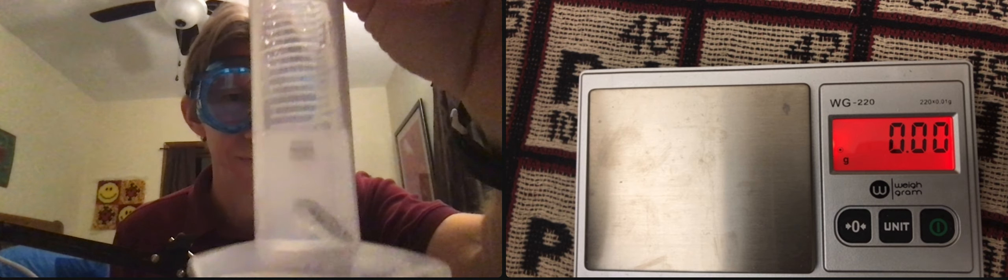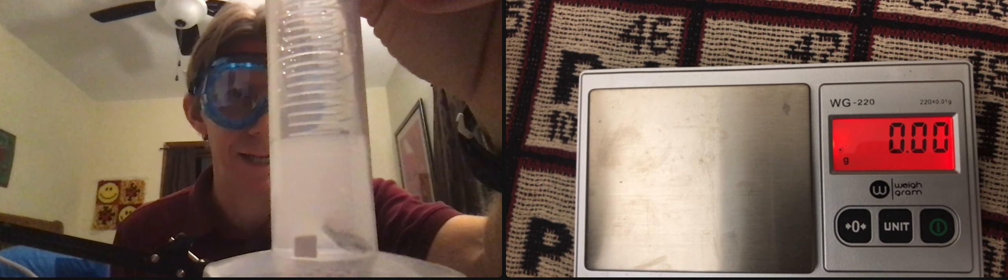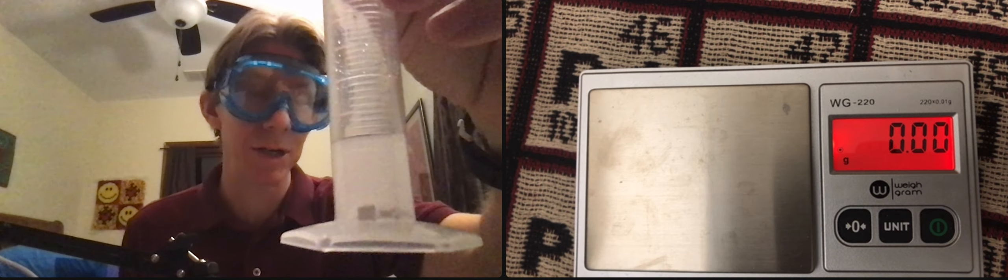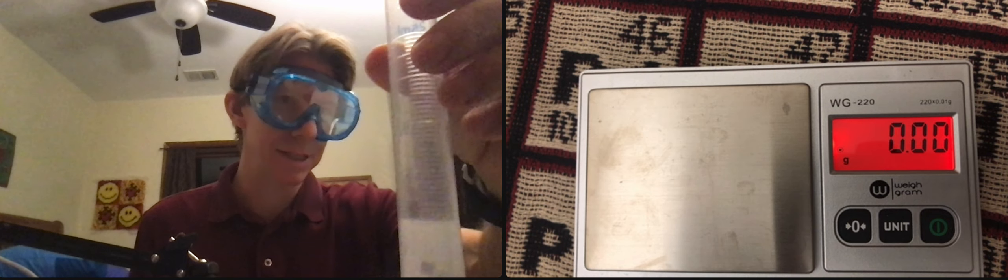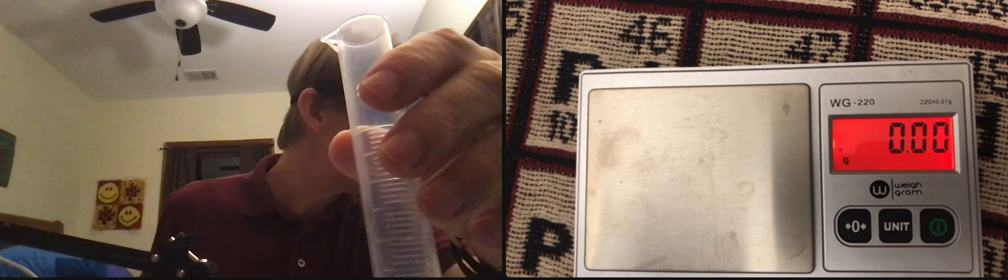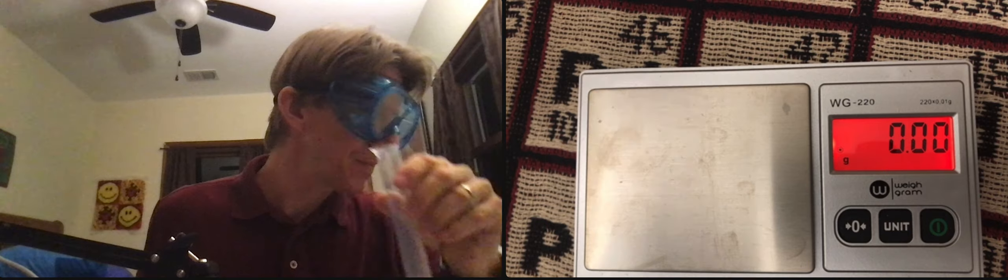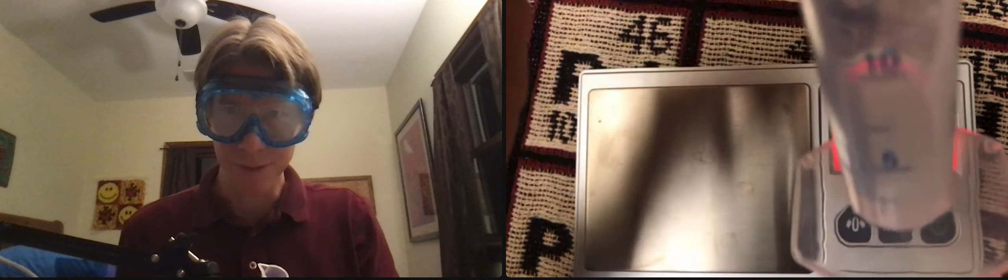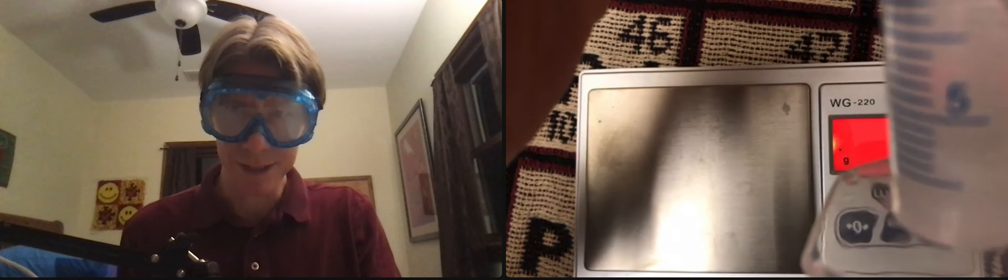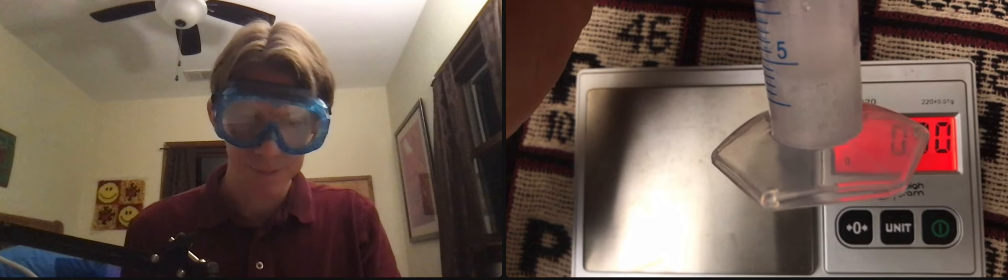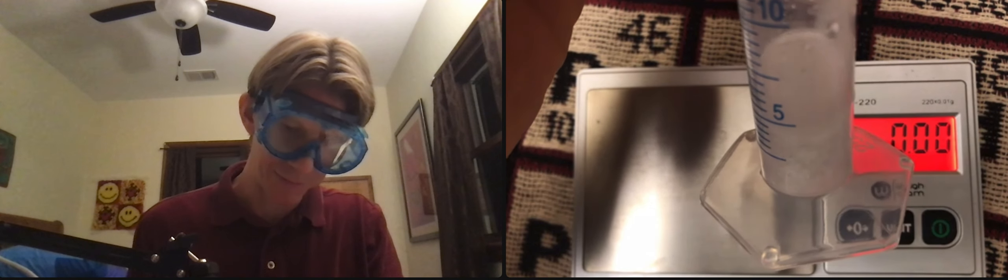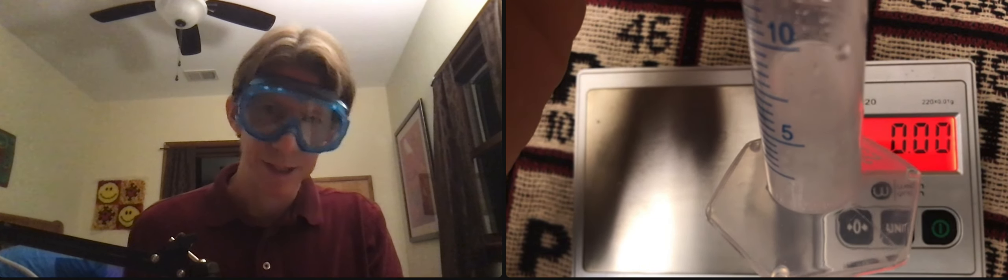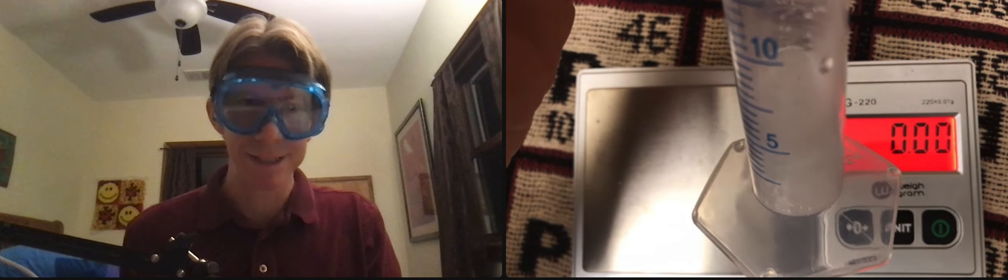Good. And that, I'm going to just let go. And so this is going to take, it says, 20 or 30 minutes. And I don't know if we can get a better picture of that at this side there. Just so many bubbles right now. And those are bubbles of hydrogen gas.